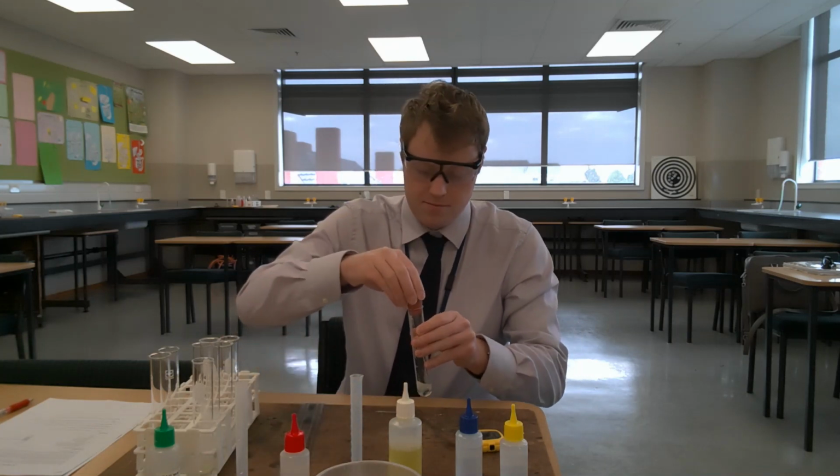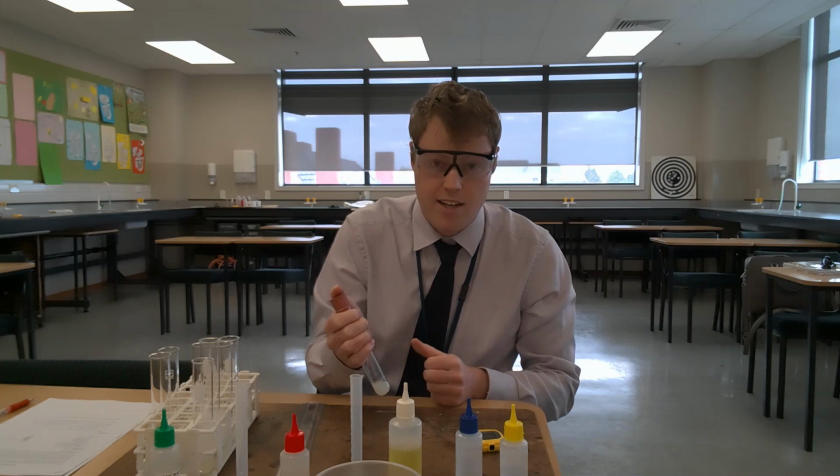Place the bung on, and now I'm going to shake for 30 seconds.